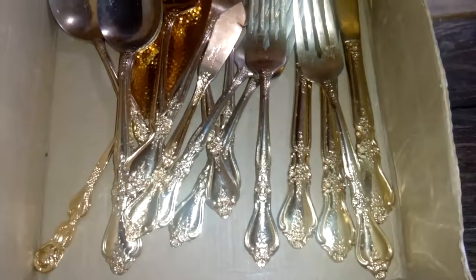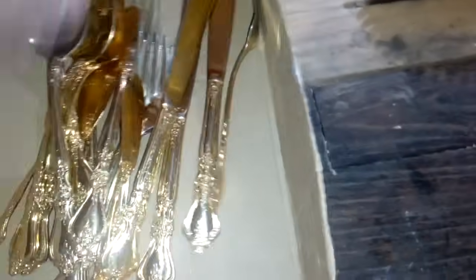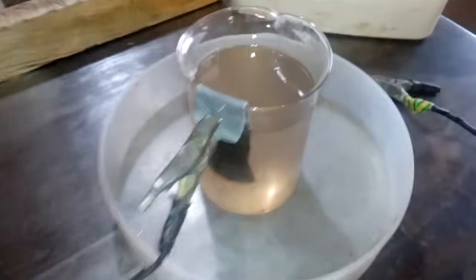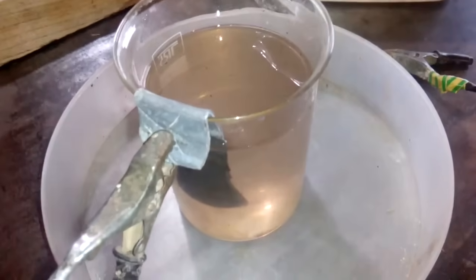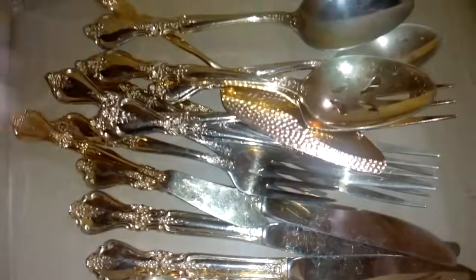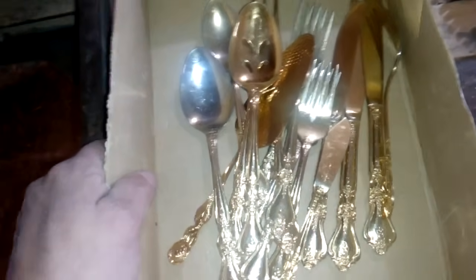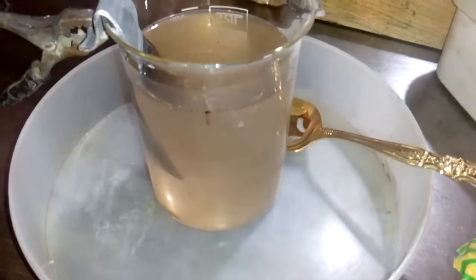All this stuff I paid around two bucks, two USD. So right now this is not for some earning - I bought that for the purpose of a video. Right now I have my sulfuric cell, this is 96% sulfuric acid. We're gonna do some reverse electroplating. I got a bucket with water, I removed inside all the finished cutlery, and right now let's start with the jar. I'll put the gloves on my hands and glasses on my head and we will start with the process.